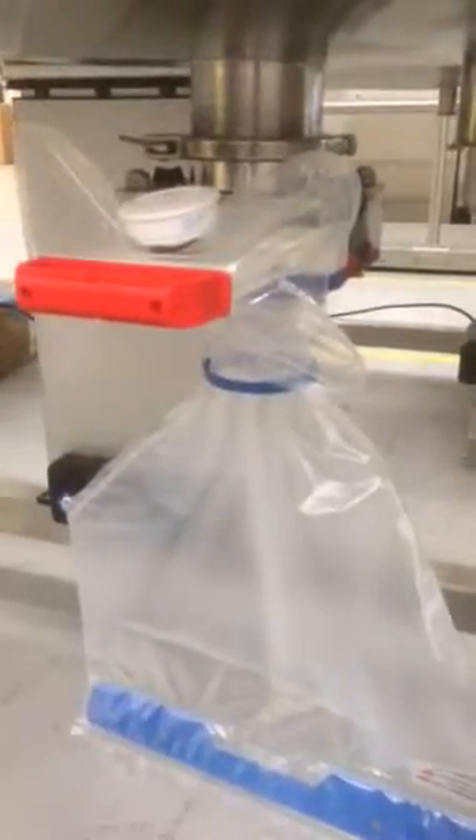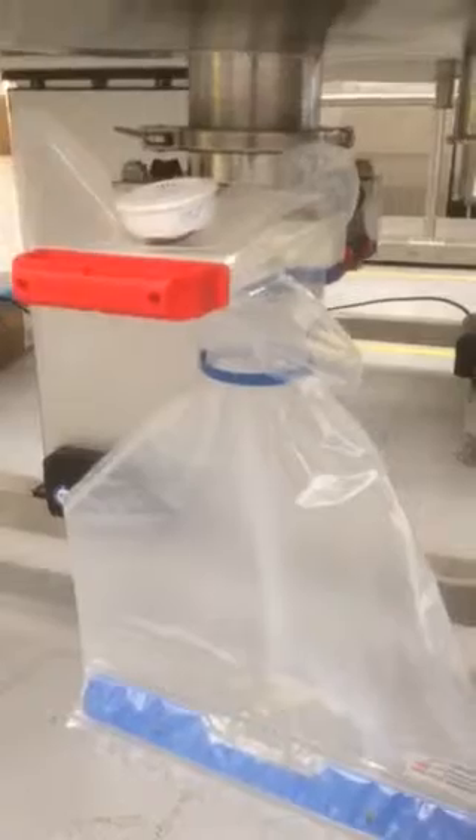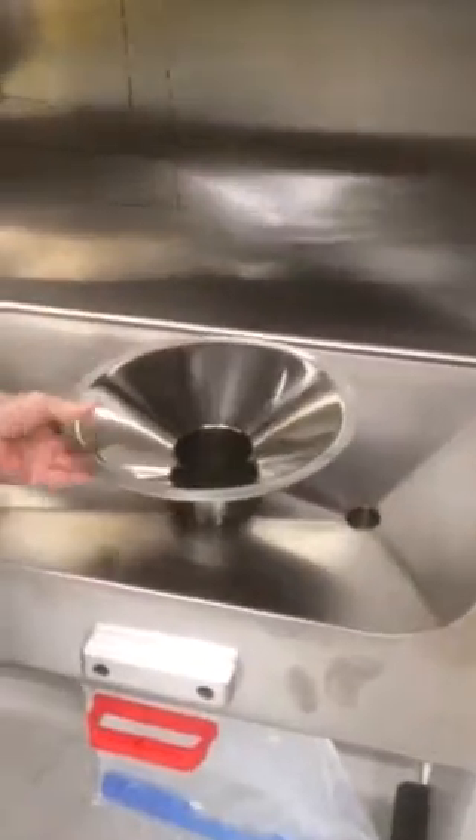Normally we would do that like so — very simply. We've only got one hand, so that would have to be managed accordingly. Filling funnel — this isn't long enough, this is just our dummy one that we supply for trials. The filling funnel then goes through.